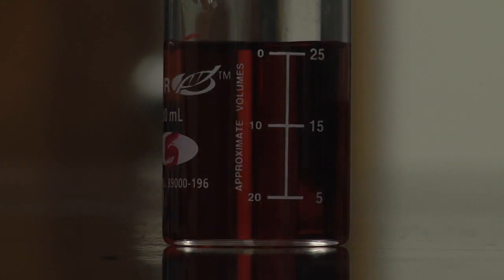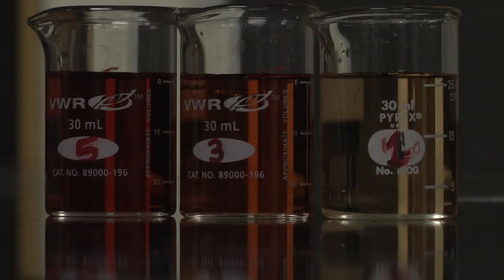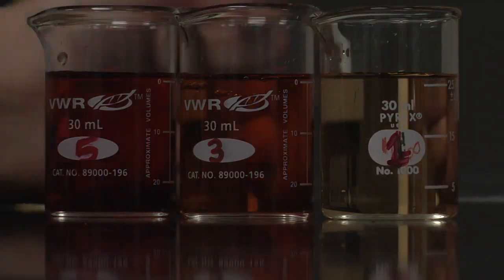And then for the magic, 5 milliliters of our thiocyanate.